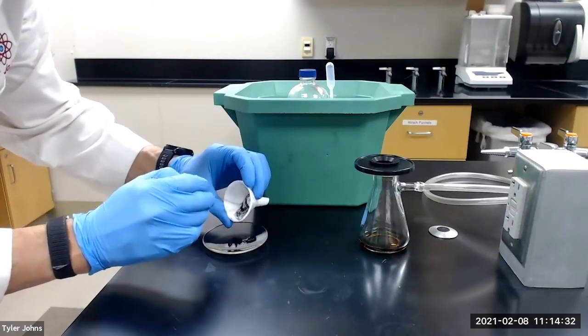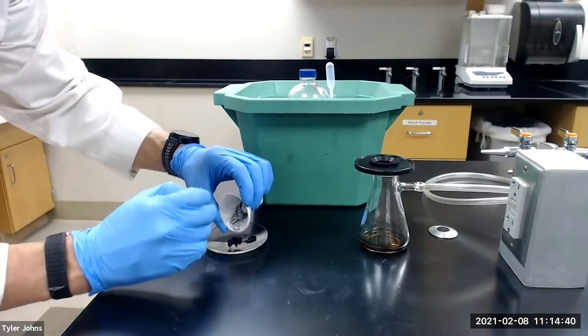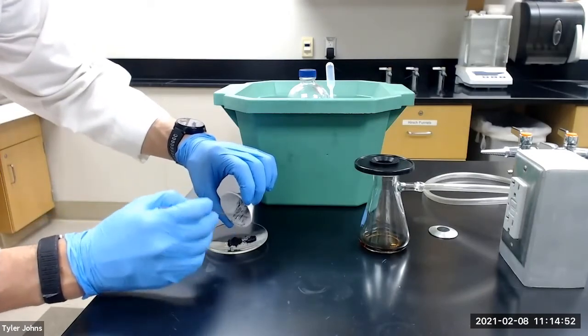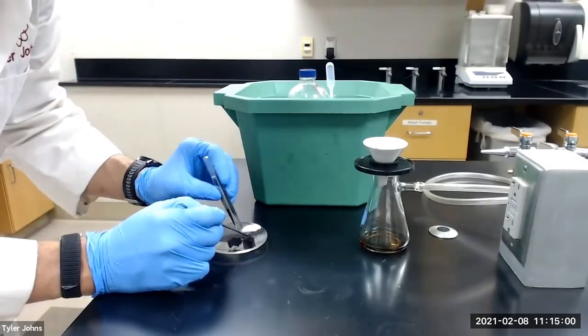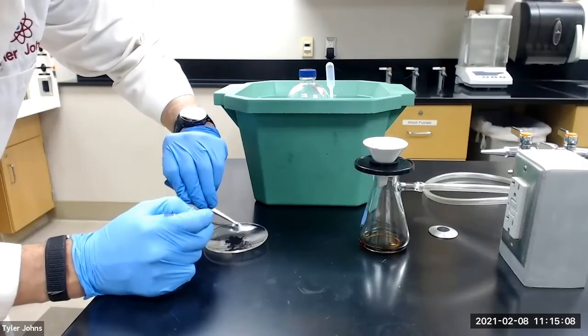We will now collect the crystals on the pre-weighed watch glass and dry them in an oven for 30 minutes.